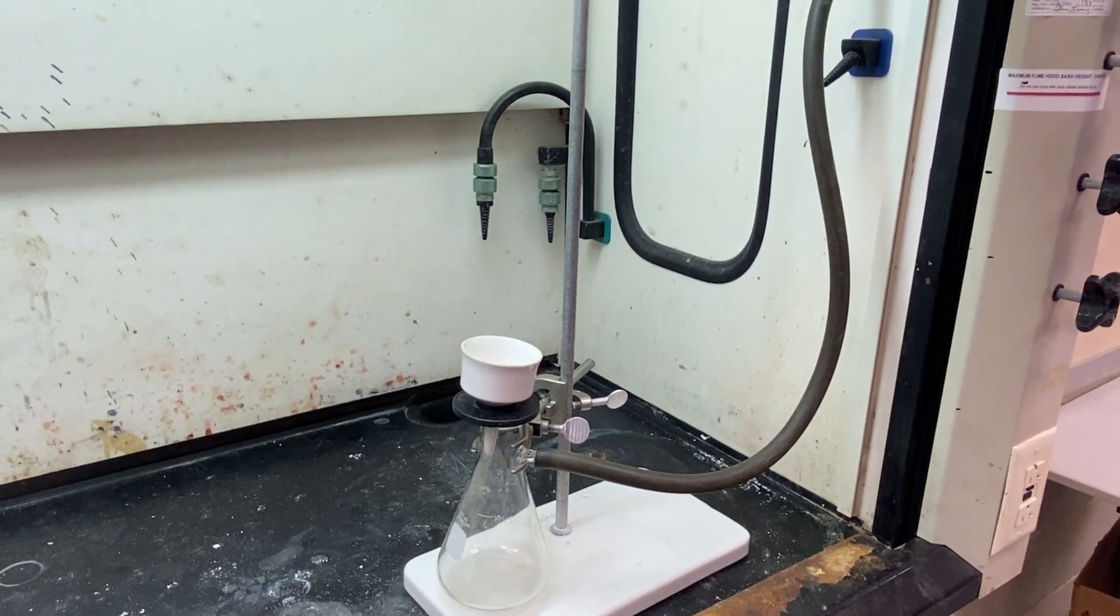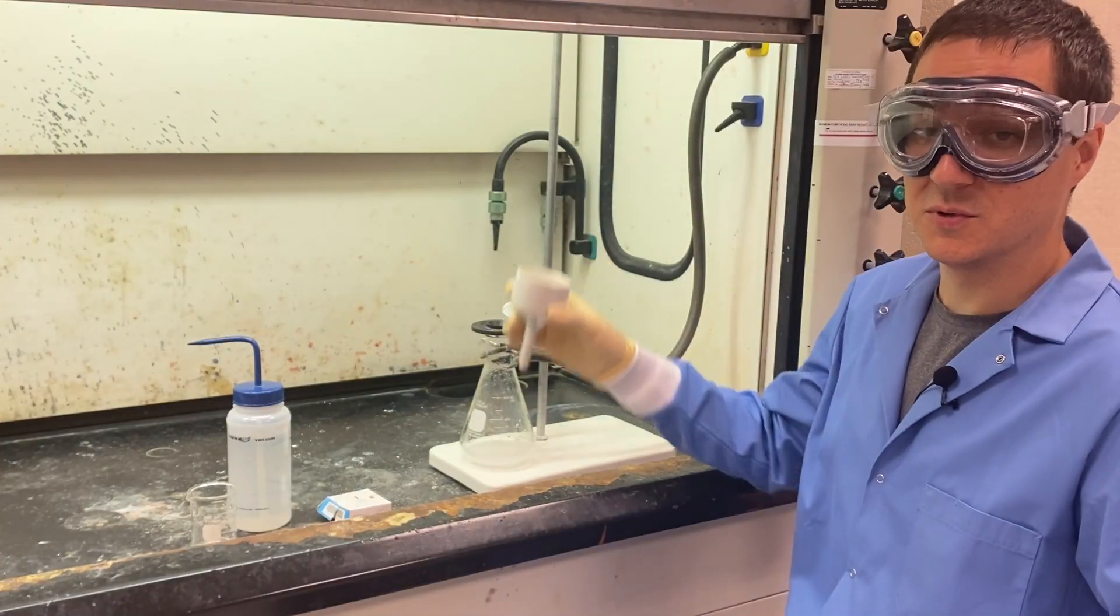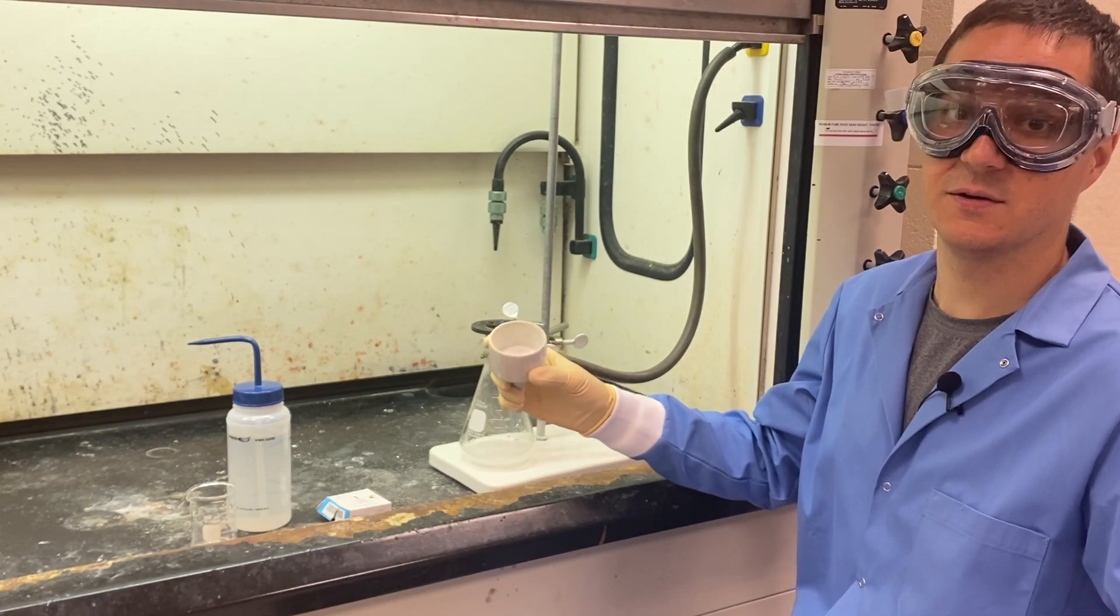When finished, the vacuum is simply turned off and the funnel can be removed. The solid can now be scraped into a container for weighing.